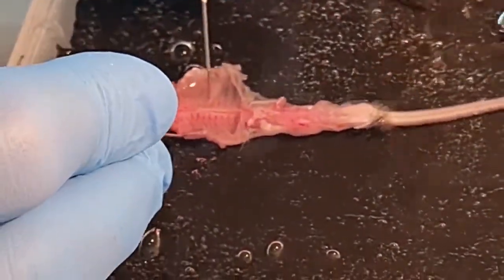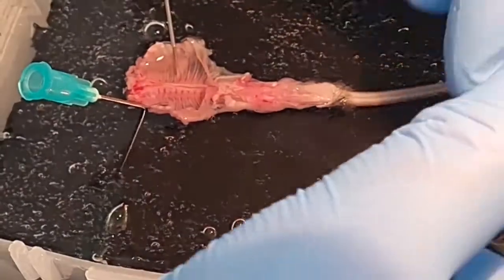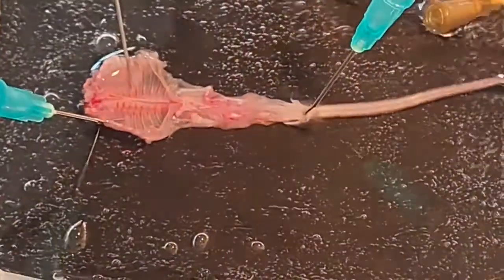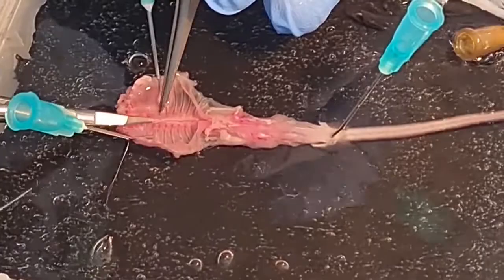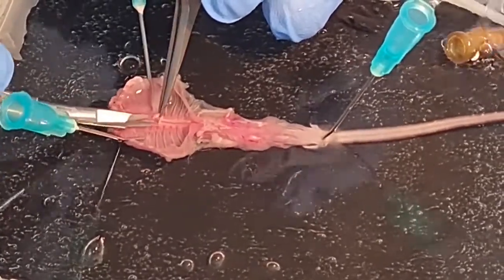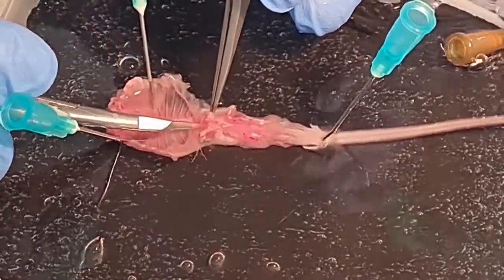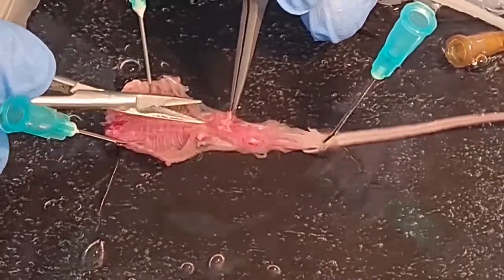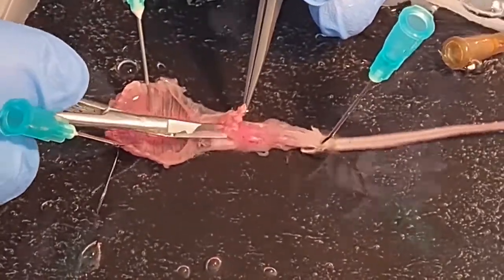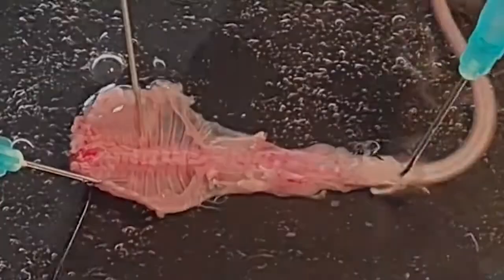After pinning out the removed and cleaned back part of the animal that contains the vertebral column, within which the spinal cord resides, you carefully cleanse the ventral surface of the vertebral column, removing the aorta and remaining tissue from the ventral surface of the vertebral bodies. This is needed to have proper access for the scissors during the dissection.